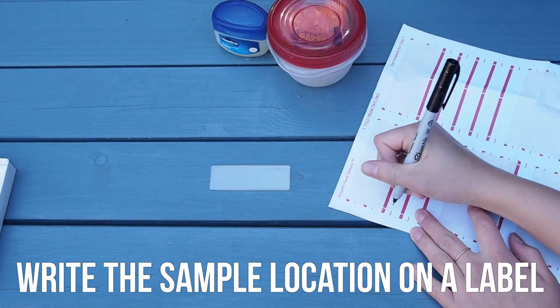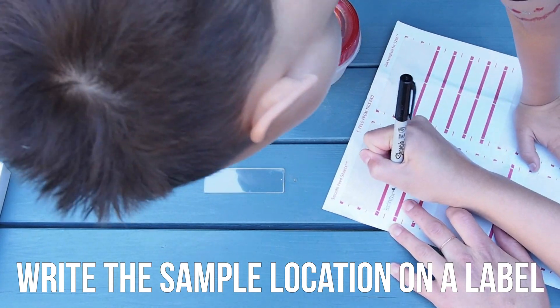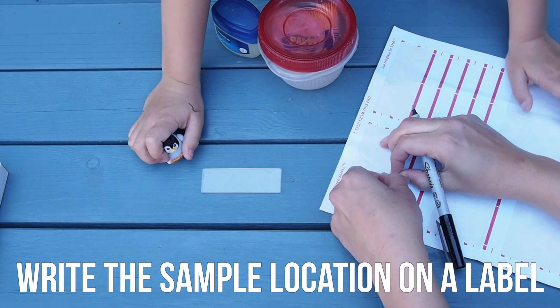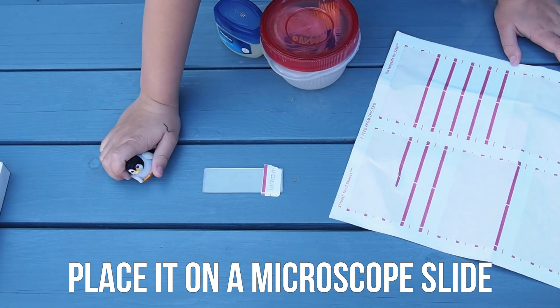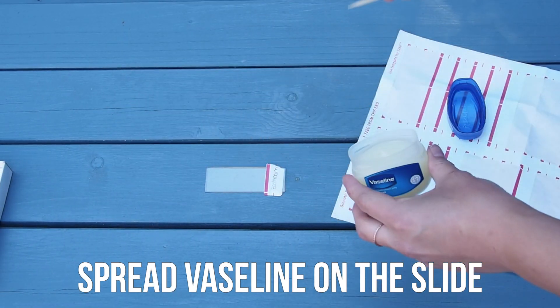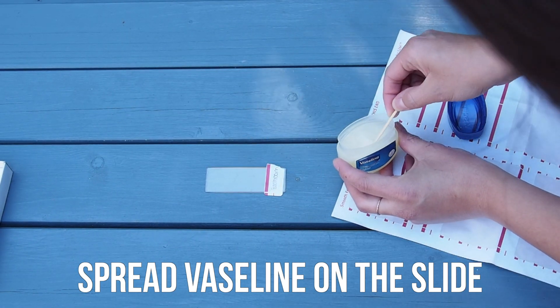Start by writing the sample location on a label. You can also do this after the fact if you want to decide as you go. Then place your label onto the microscope slide. Spread a thin layer of Vaseline onto the center of your slide using a toothpick.